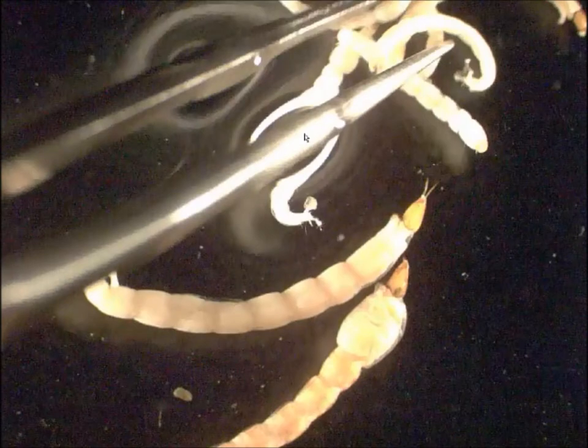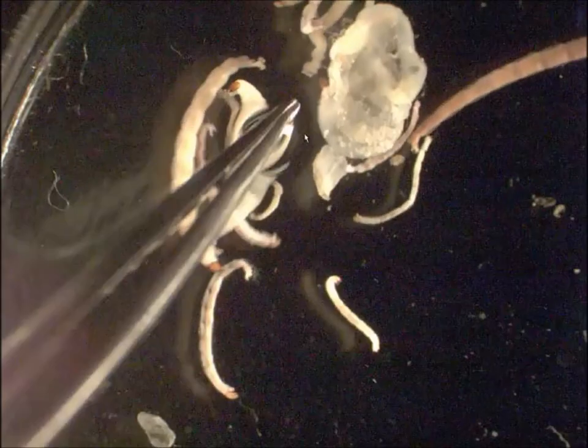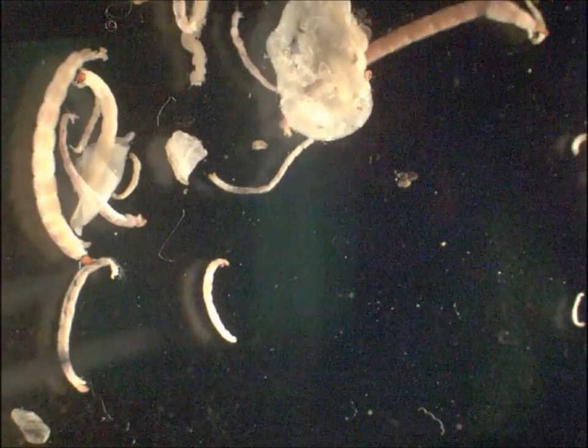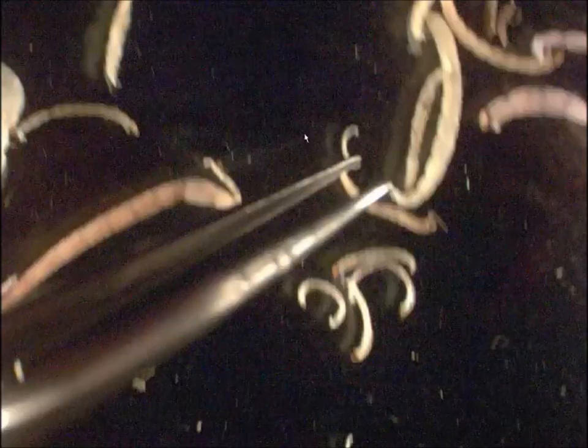Once I collect all my Tanypodinae, I remove them from the dish and put them in a vial marked 'Tanypodinae.' If I were going to do Level 2 taxonomy, after sorting everything out by subfamily, I would go back to one vial at a time and start working on identifying those to genus.